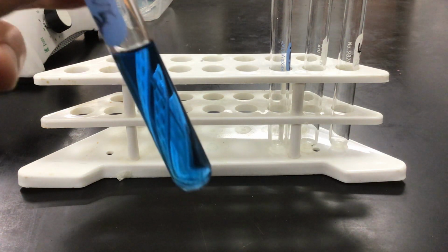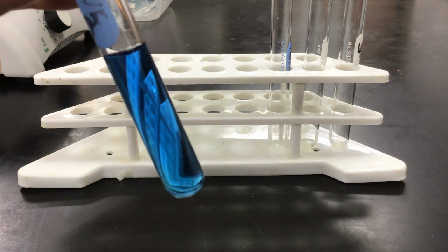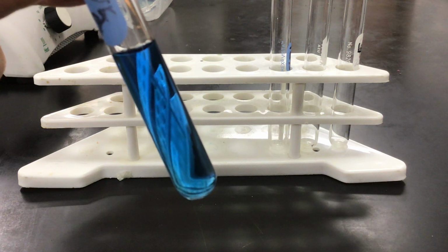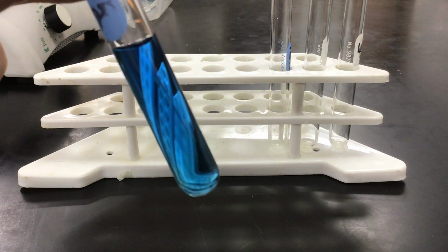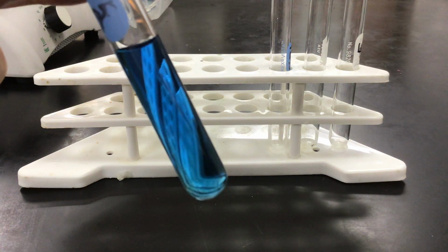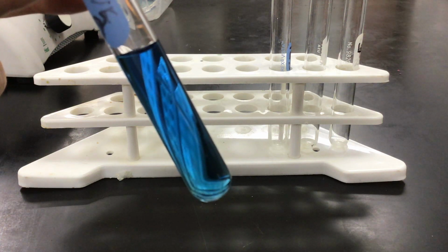Now I added equal drops of each. Theoretically, if my drop volumes were exactly the same and the substance was the same concentration, the big key here is the size of the droplets. If the droplets were the same, it should have gone back to that original kind of greenish aqua color, because then we have equal amounts of both the yellow acidic ions and the blue basic ions. But here, because it is blue, you can see that it has now gone past neutral pH, which is 7, into a basic realm, which is over 7. And when I added the HCl the first time, it was yellow when it was in the acidic realm.